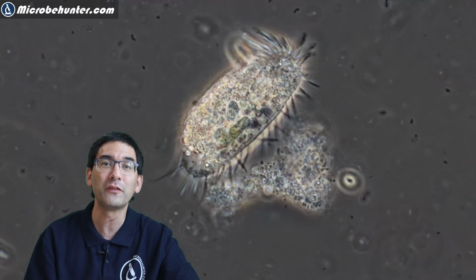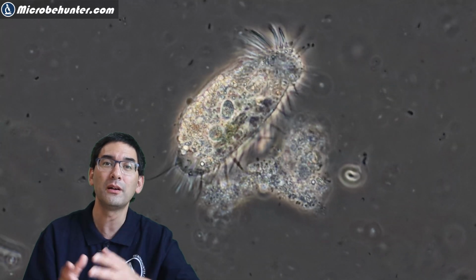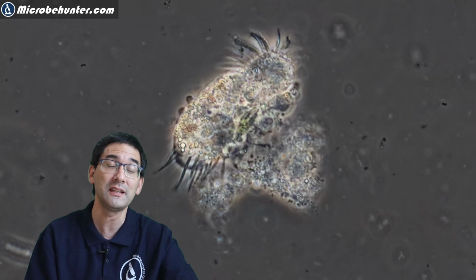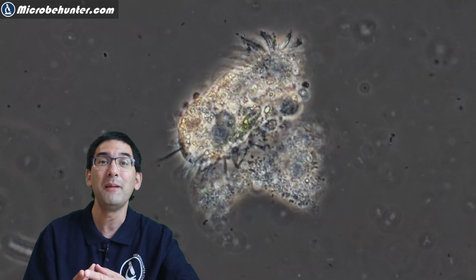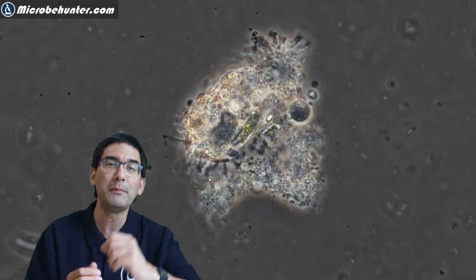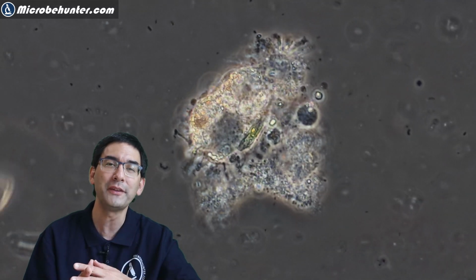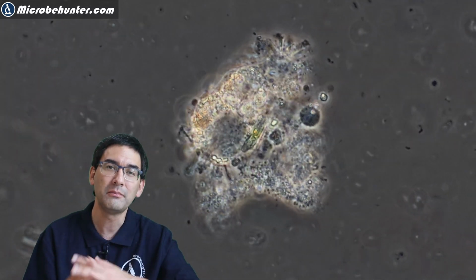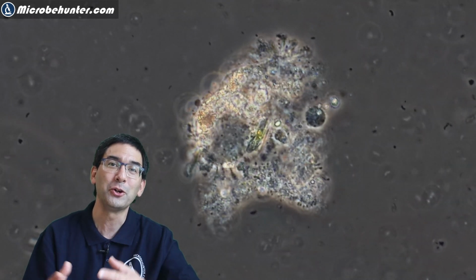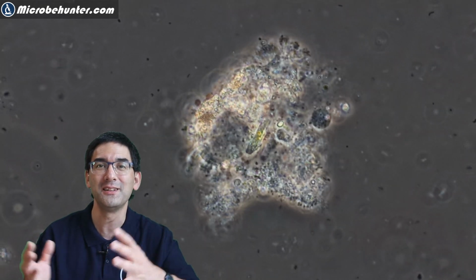Now, I did not only observe this once, but as a matter of fact, I think about three or four times with different cells. And I was wondering why this is the case. I think that this could be because maybe there was still a little bit of soap or detergent on the microscope slide from my last cleaning session. I'm not quite sure if that is the real case, but I think that is a good working hypothesis. Detergents generally dissolve the cell membrane and therefore they break open the cells, and this is of course the reason for cell death.